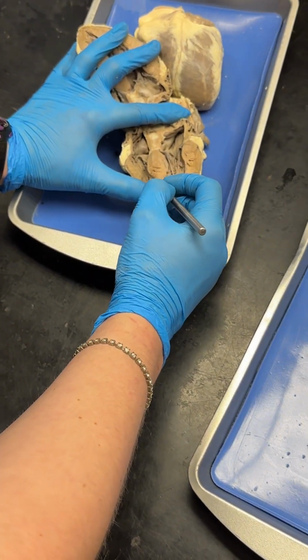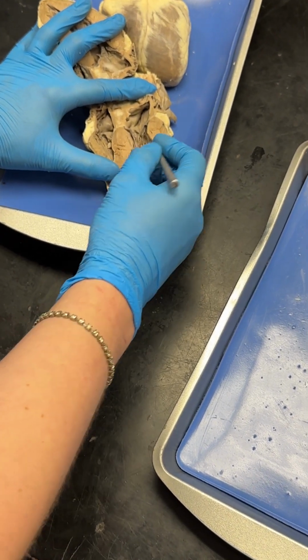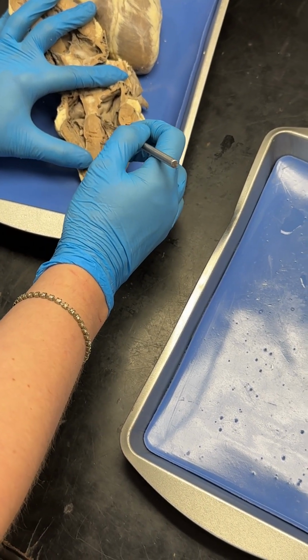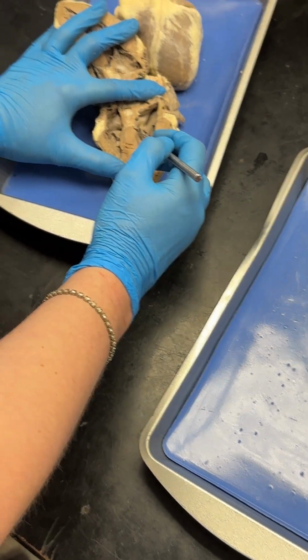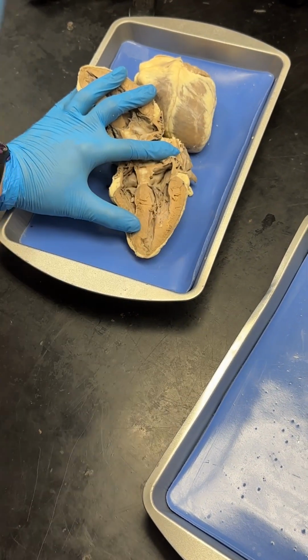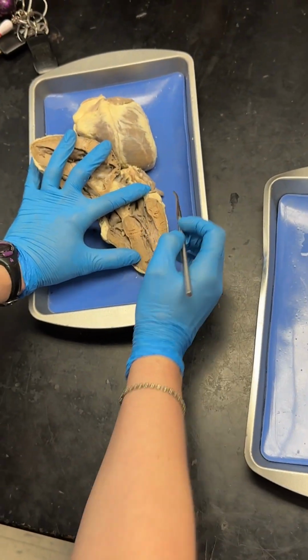Then you can see in the ventricles those valves really clearly. So here on the left side we have our bicuspid, not tricuspid, valve. This is also sometimes called the mitral valve because it looks... I have never been able to see it, but some people say it looks like the mitre of a bishop, so that's why it's called the mitral valve. I guess it's open to interpretation.